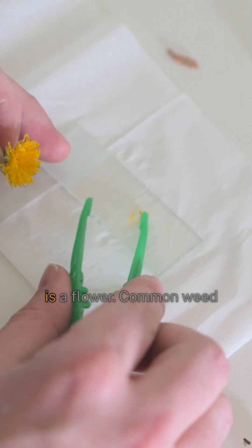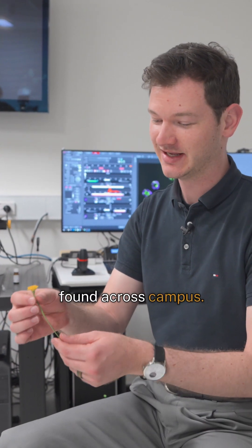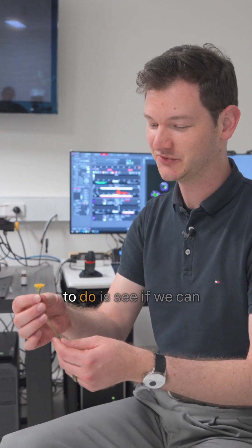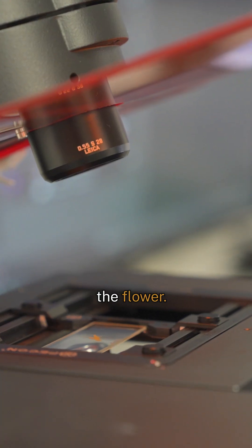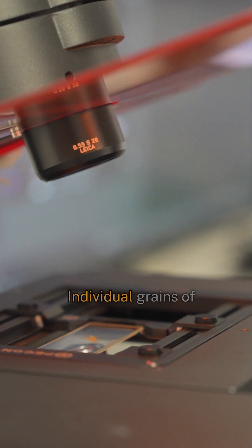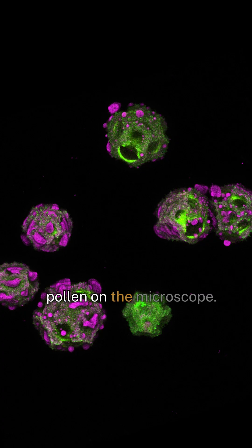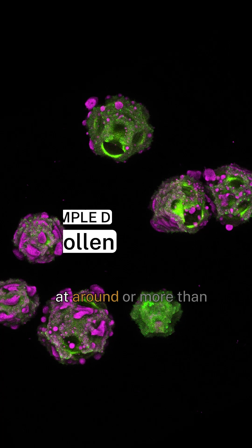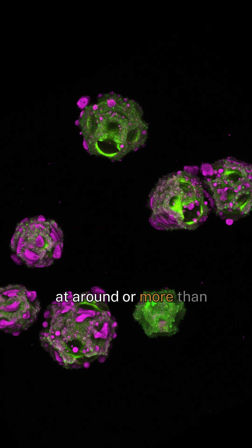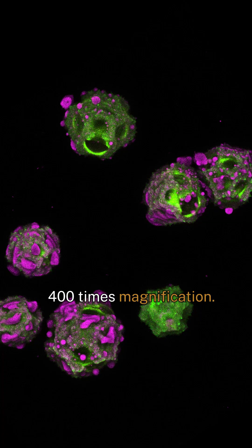Our next specimen is a flower — a common weed found across campus — and what we're going to do is see if we can get some pollen out of the flower. Here are individual grains of pollen on the microscope, this time at around or more than 400 times magnification.